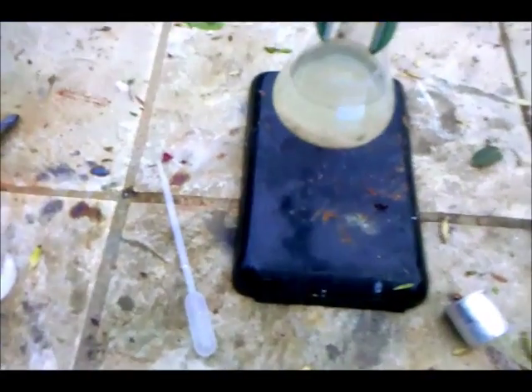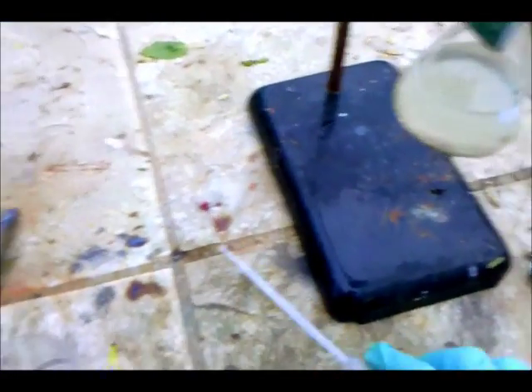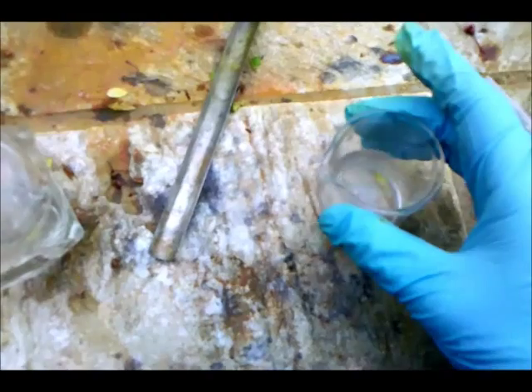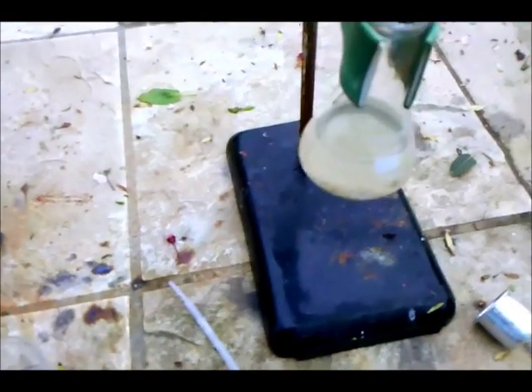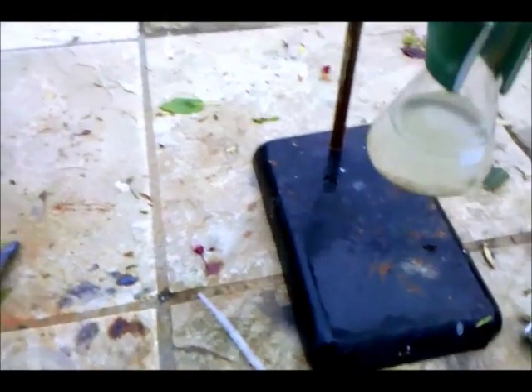This is not your product. The next step is going to be to add potassium hydroxide solution until the solution becomes basic. This will destroy an intermediate product that's formed in acidic conditions.